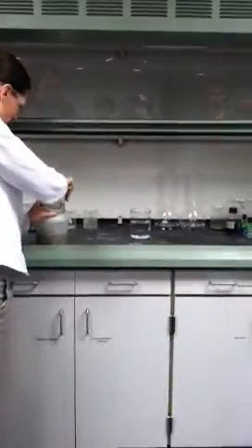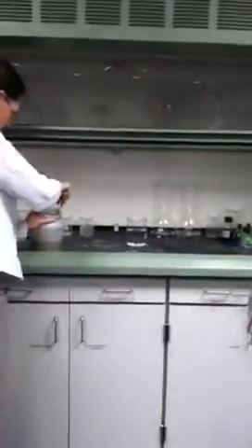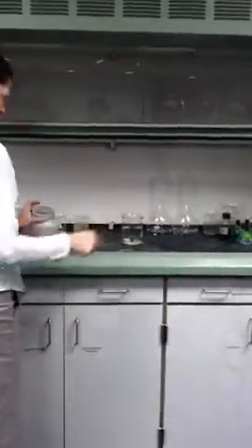That's what's happening. I know. I don't want to miss this. I can take them on my computer and I'm like... I feel like that one was bigger than the one last time.